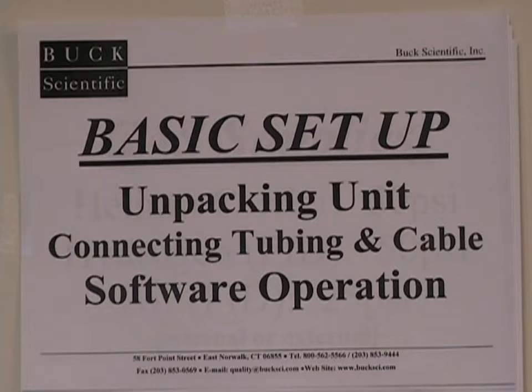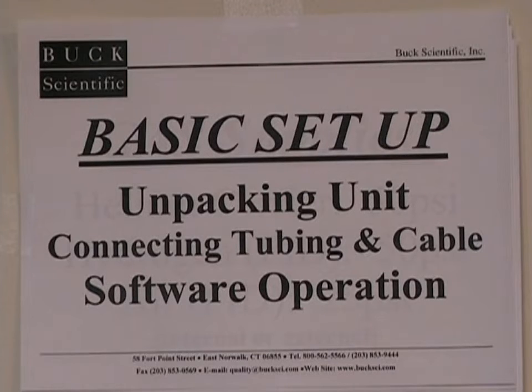Afterwards, we will install the Peak Simple on a suitable PC and connect that to the instrument for control of the various analytical parameters.